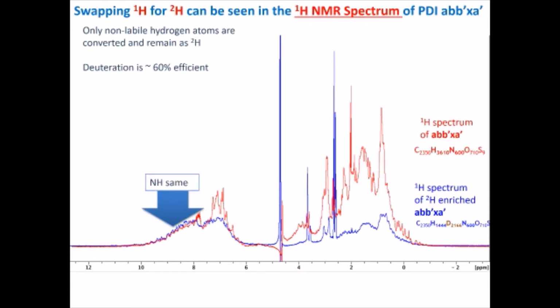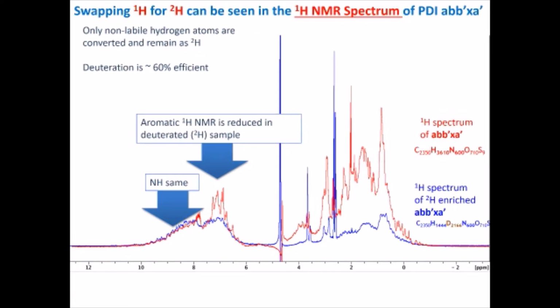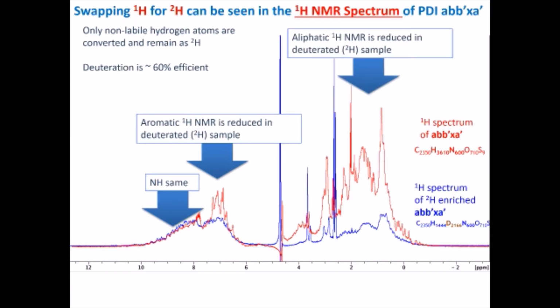The NH region is the same because you have that interchange, that acid-base exchange, between the hydrogen attached to the nitrogen in the peptide bond and the protons in the solvent. The aromatic section, if you compare with the spectrum of the non-deuterated protein, is reduced. You are losing the peaks from those aromatic hydrogens. And the aliphatic area also becomes simpler, because again those hydrogens are not labile. They are not going to be involved in any acid-base exchange with the solvent. And as you can see, that area of the spectrum is also much simpler.